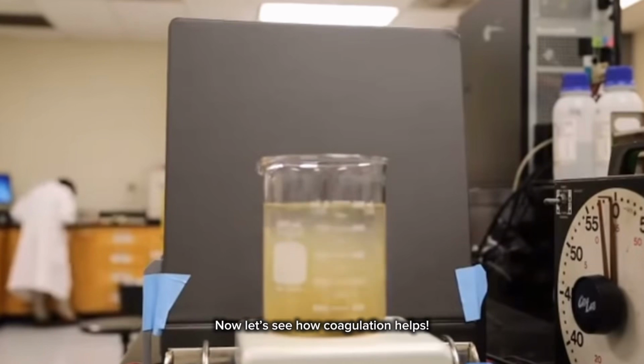Now let's see how coagulation helps. We divided the clay mixture into two tubes. Tube A, just clay and water, and Tube B, add 5 drops of aluminum sulfate and lime water. After a few minutes, Tube B cleared up. Flocs formed and settled to the bottom. Aluminum sulfate and lime water form aluminum hydroxide, a sticky substance that traps clay particles. So that's why it cleared up.